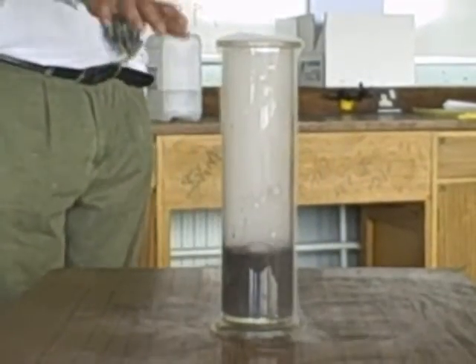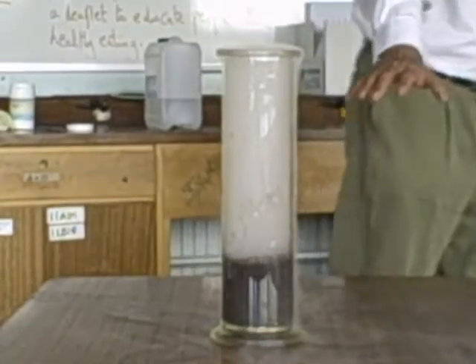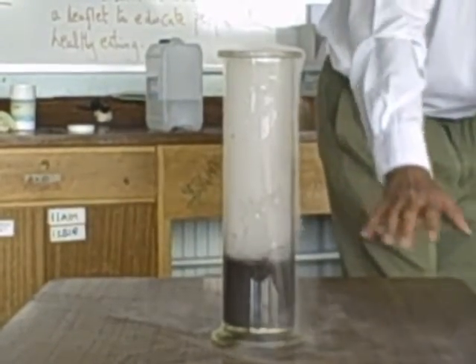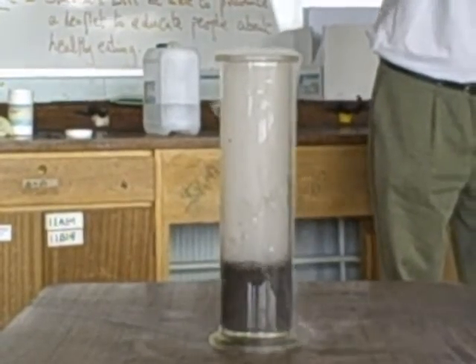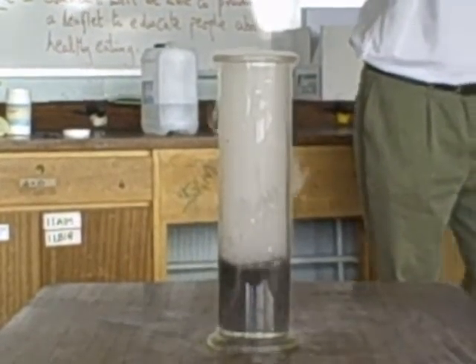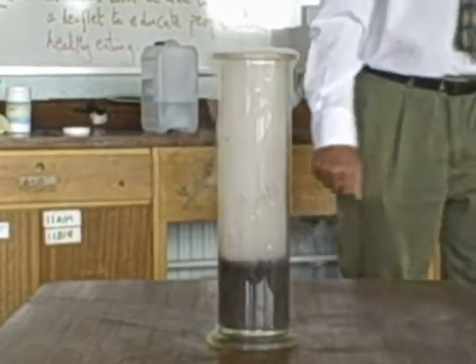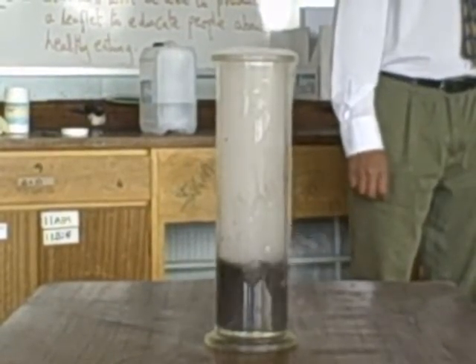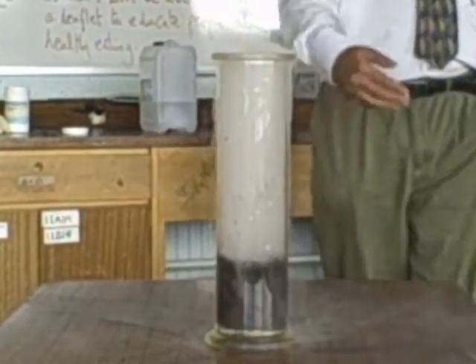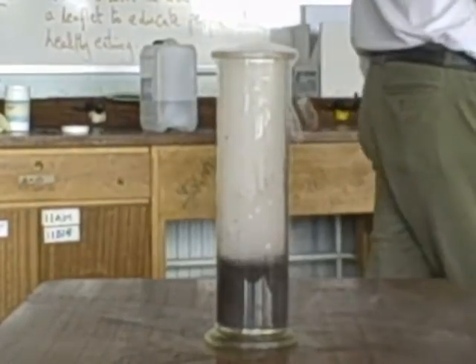In this experiment, you'll be asked to investigate how changing the concentration of hydrogen peroxide affects the rate at which it breaks down into oxygen and water. You'll need to think carefully about how you will collect the oxygen and measure how much is made. You'll need to think about how you will change the concentration of the hydrogen peroxide. You'll need to think about how you're going to collect your results and design an appropriate results table to do this.